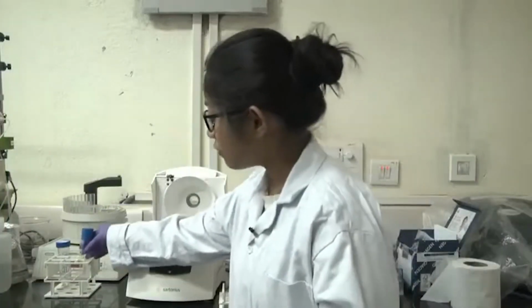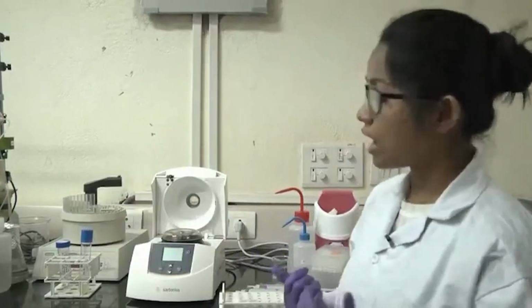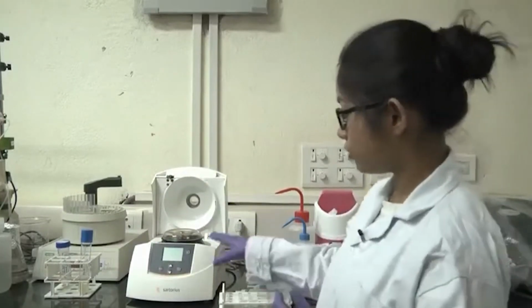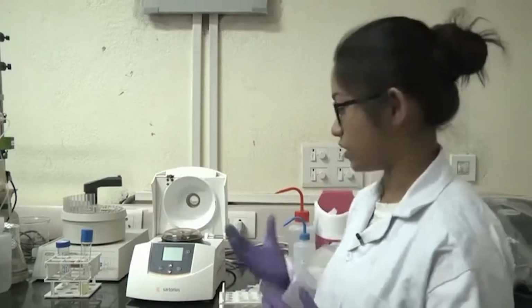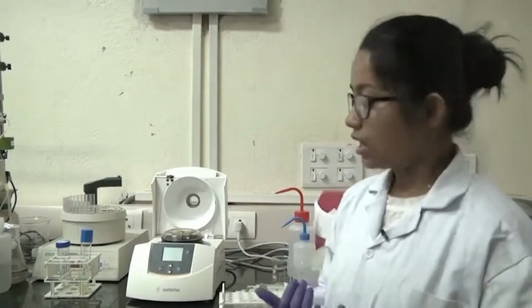After you have grown a particular culture overnight, another thing you will need is a centrifuge, because the steps required during the plasmid extraction require a centrifuge. Also, you need the solutions for extracting the plasmid. Today we will use a kit provided by a particular company. Different companies provide this kind of kit. Also, you can make those solutions in the lab following a molecular biology book.